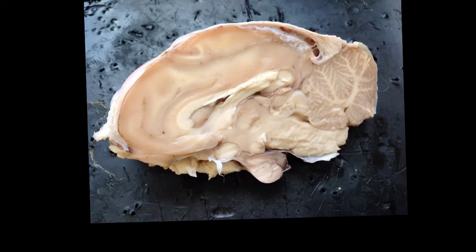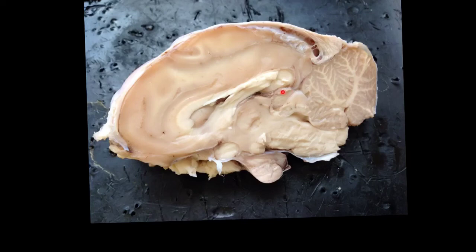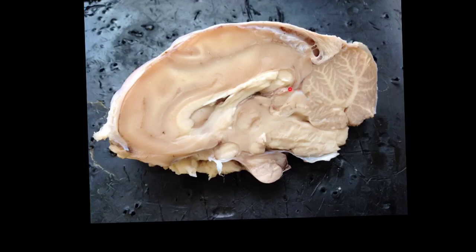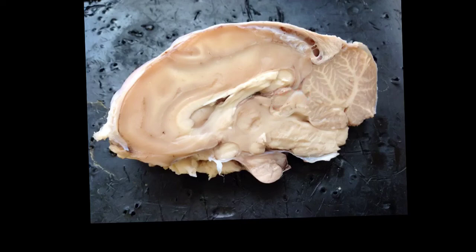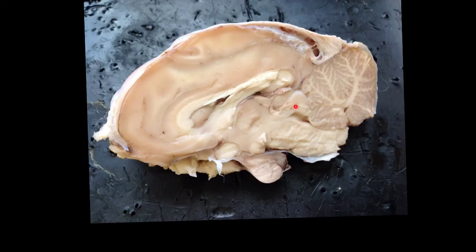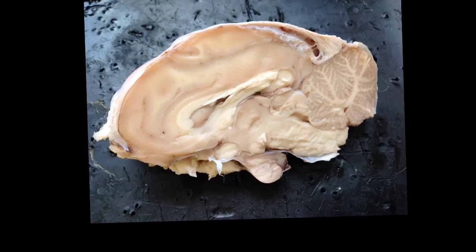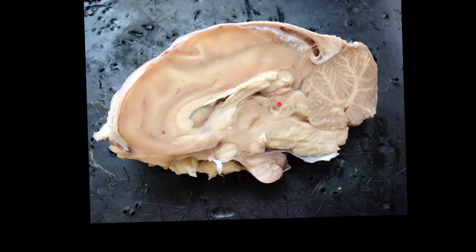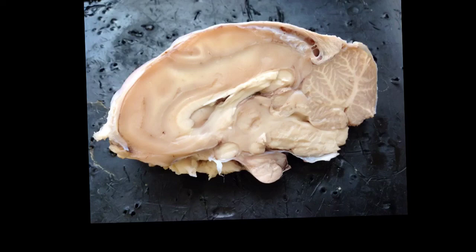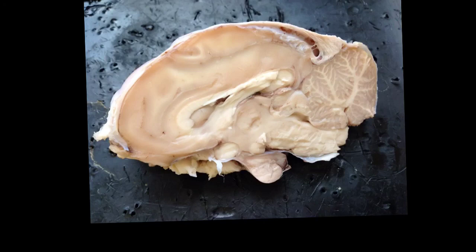One more structure — it's a bit of a mouthful — called the corpora quadrigemina. The 'quadra' part refers to four separate structures. You can only see two of them here because it's a mid-sagittal section; there are actually two on the right and two on the left. Here is the inferior colliculus, which is the smaller component of the corpora quadrigemina, and this is the superior colliculus right here.